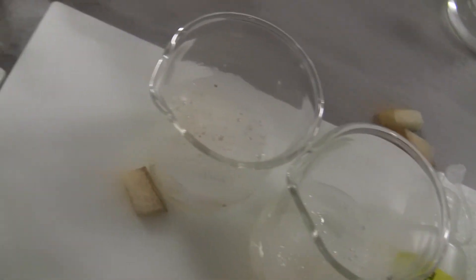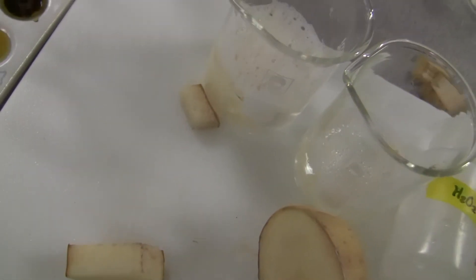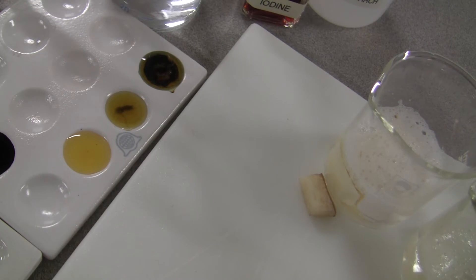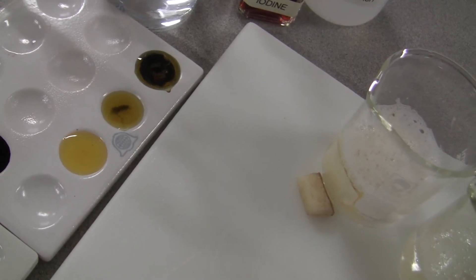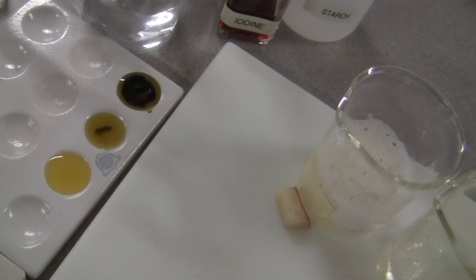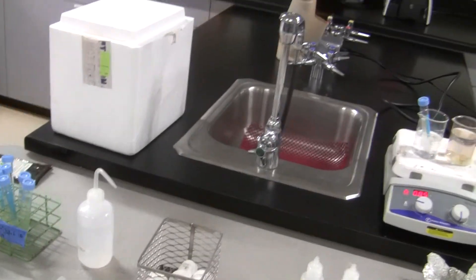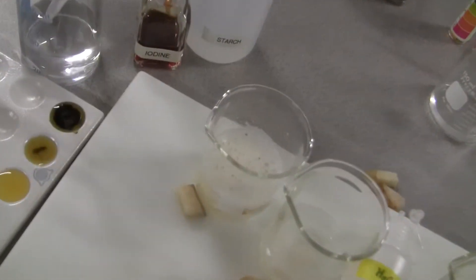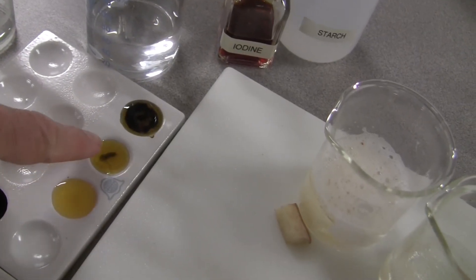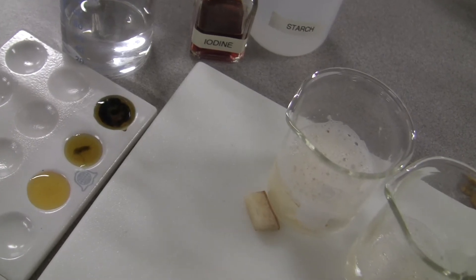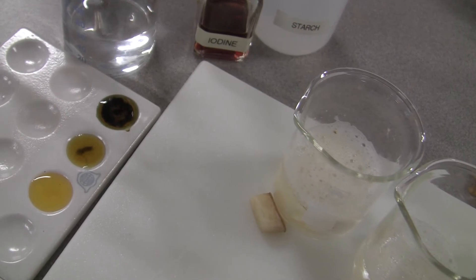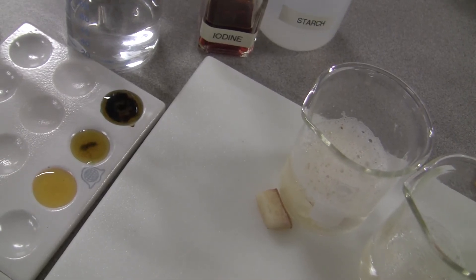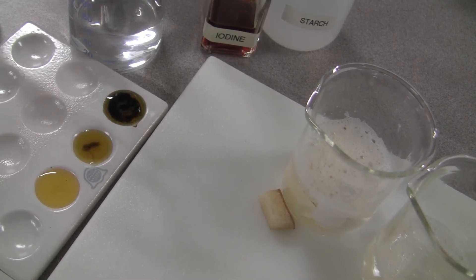Then this one, I put saliva. I put saliva and starch and iodine. Nothing happened. Then I put some saliva in a cooler like that, on ice. And then I put it in here in this well, the second one. And then of course, guess what? Well, I guess it didn't stay there. Some of the starch is showing up with iodine. But that is with the iced saliva, amylase, if you would.